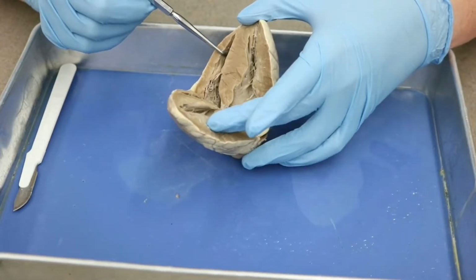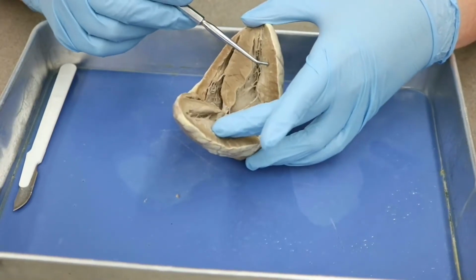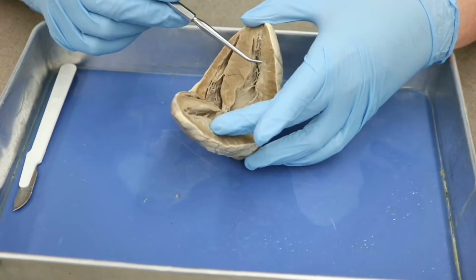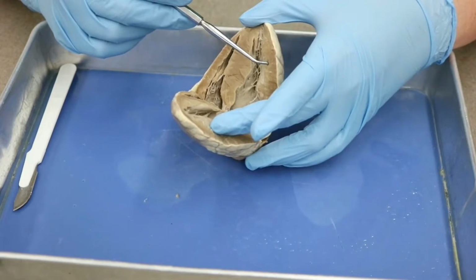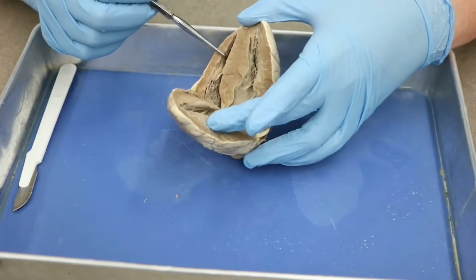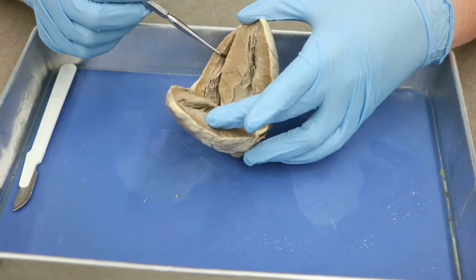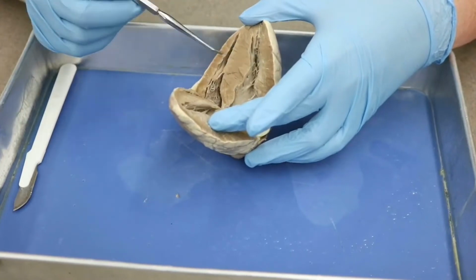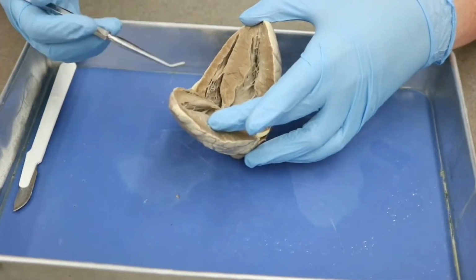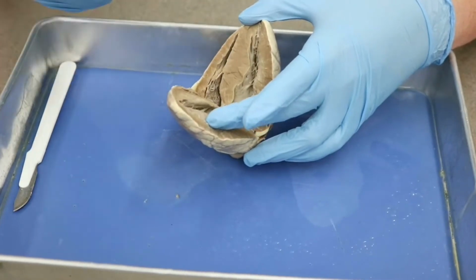because the right ventricle only has to pump into the pulmonary circuit, whereas the left ventricle has to pump into the systemic circuit. So it has to be able to pump blood all the way to your toes and all the way up to your brain. But the right ventricle only has to pump to your lungs, which isn't very far. So because of that, the muscle is much thinner on this side than it is on this side. Okay, so if you were in doubt when you were looking at the external surfaces, this is the quick and easy way to make sure that you are correct.